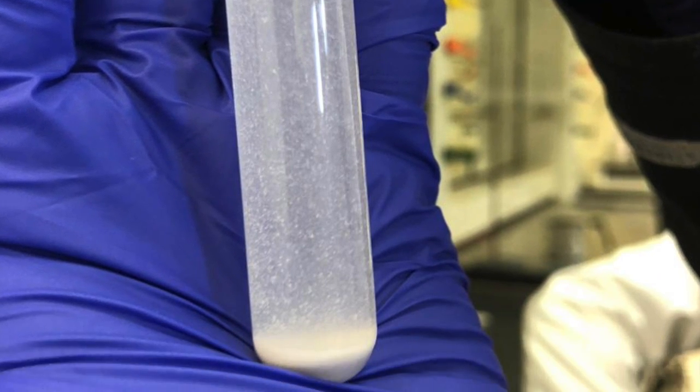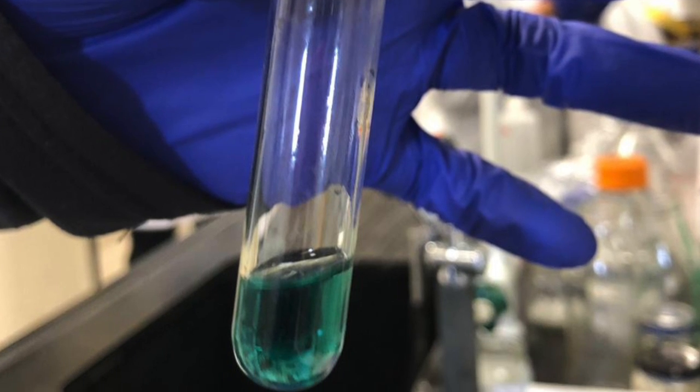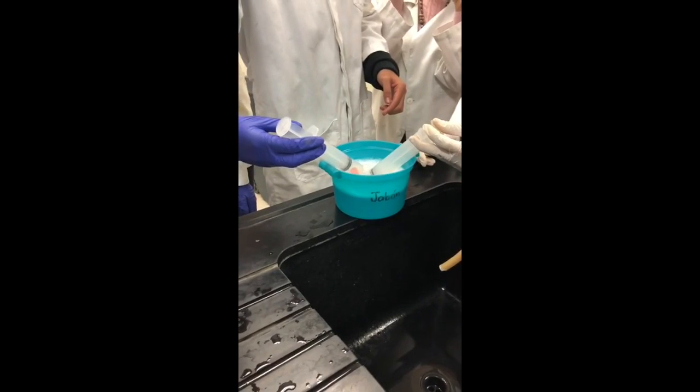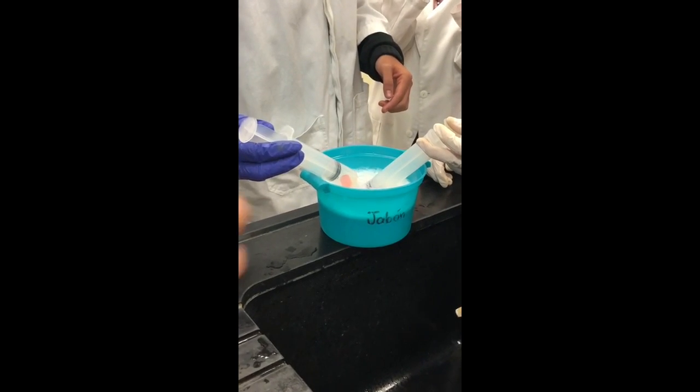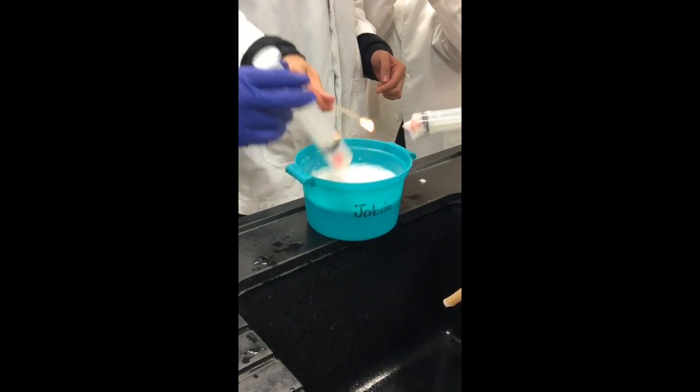For practice number 8, we could see how we could get gases such as H2, O2 or CO2 upon different reactions, and then we could observe how these gases reacted to different components such as copper or fire.